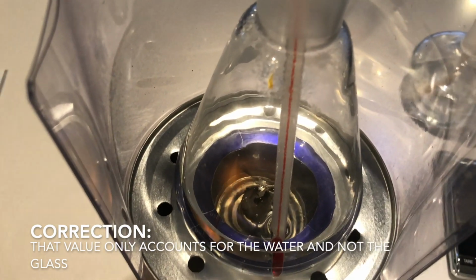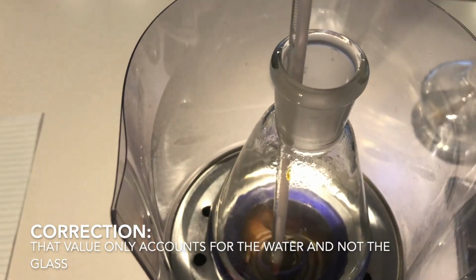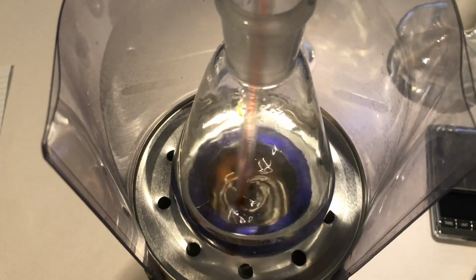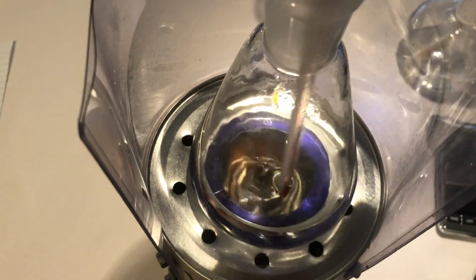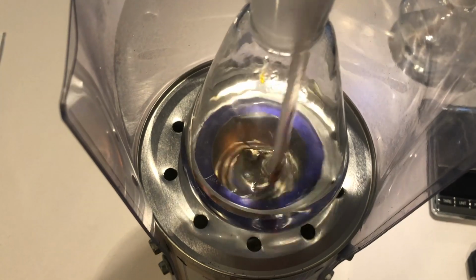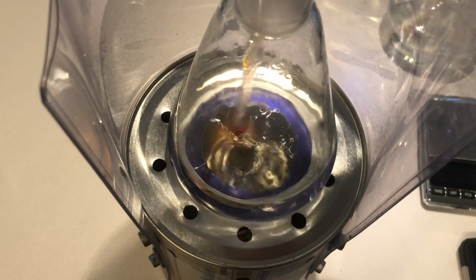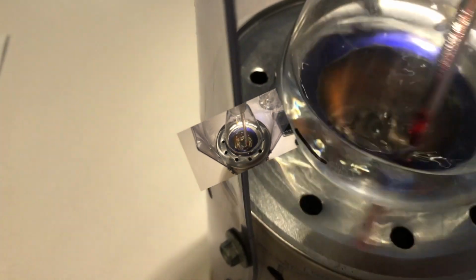Technically, the glass is also getting hotter. Just to make sure we're getting a reading that's not inflated and too high, we're going to do some stirring. We don't want a pocket of water at the bottom to do all the absorption of energy. We want the entire sample of water to be involved in this heat transfer. About a minute left. Final temperature, which is 70.